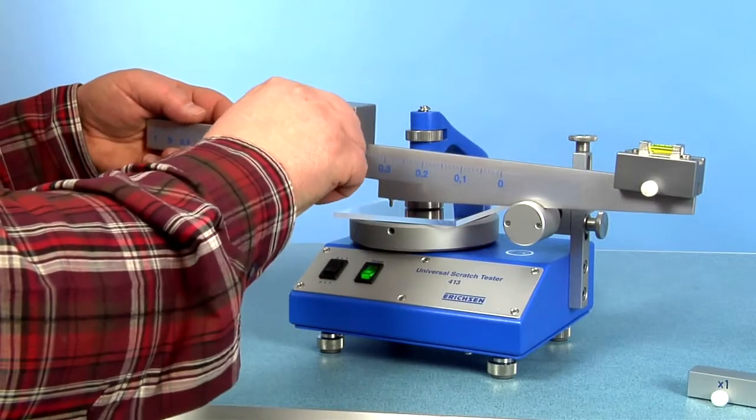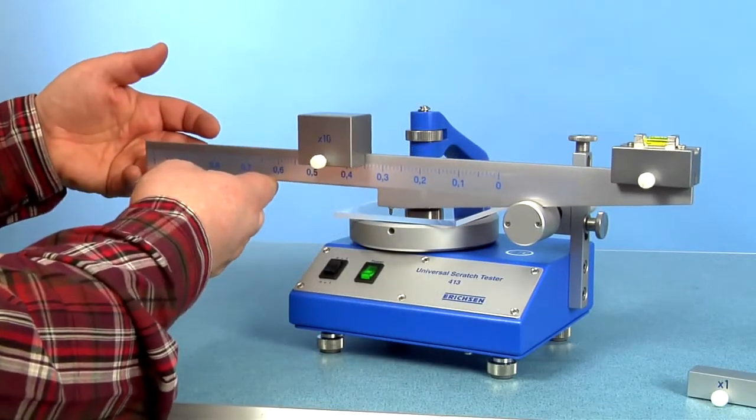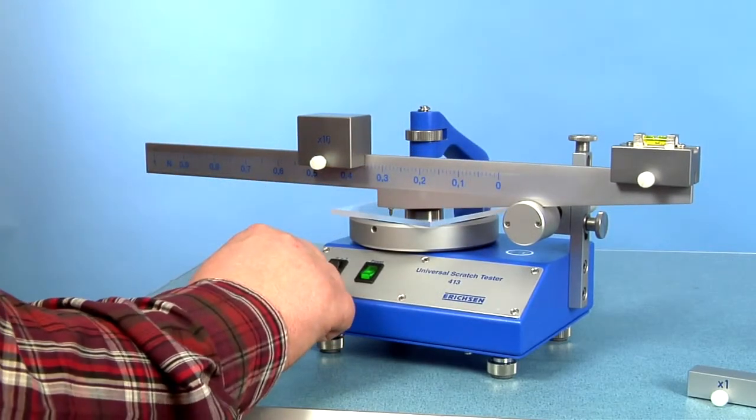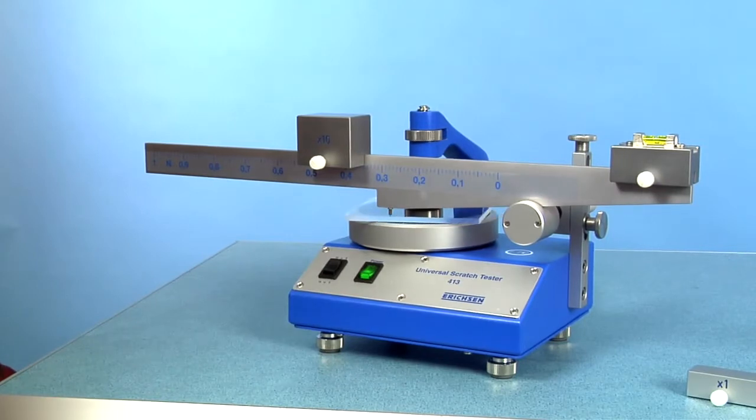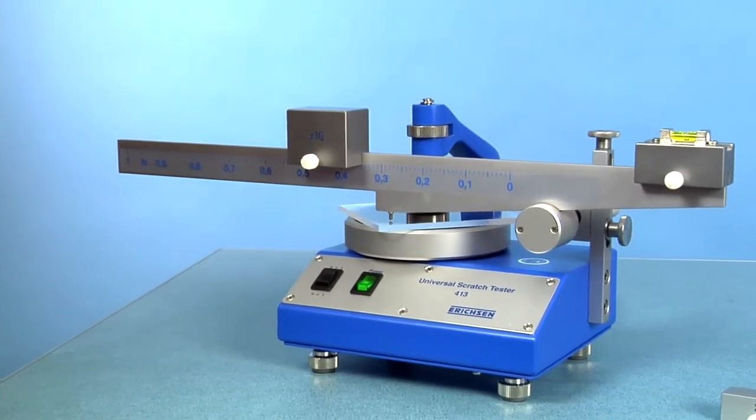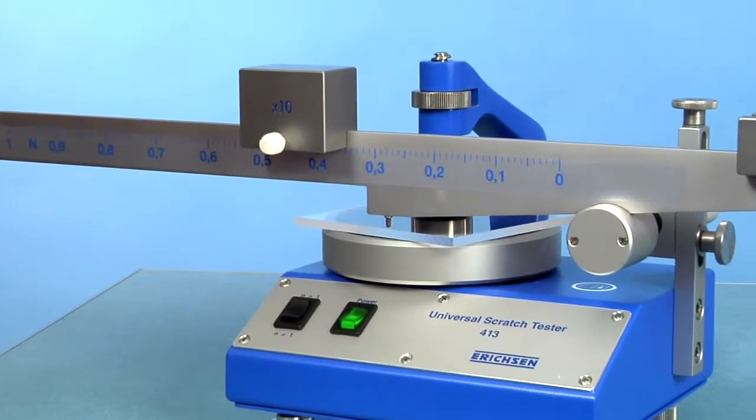The first test weight force should be suitable to leave a distinct scratch, beginning at the biggest possible radius for a possibly high number of parallel scratches.